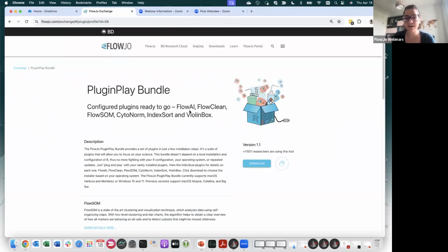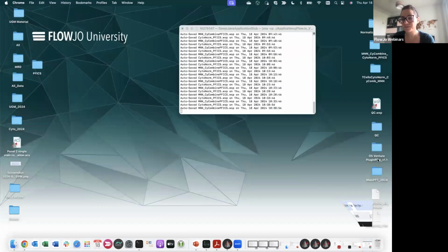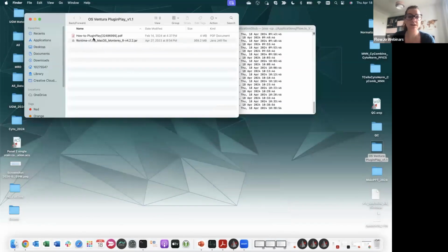So you will have access to FlowAI, FlowClean, and Cytonorm, which I will show you in a second. And then you will need to click on the download button. When you click on the download button, you will have a zip folder. Okay, I have unzipped it here, and you have a jar file, a plugin folder, and a PDF.